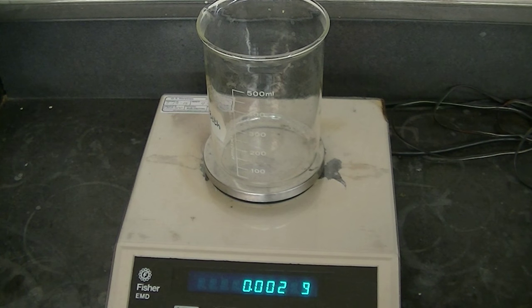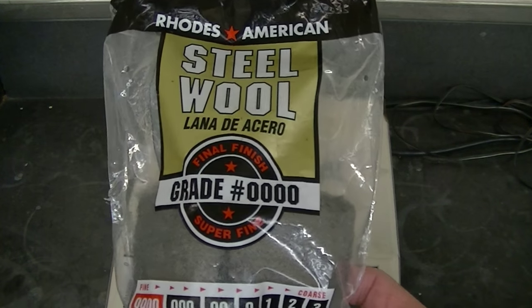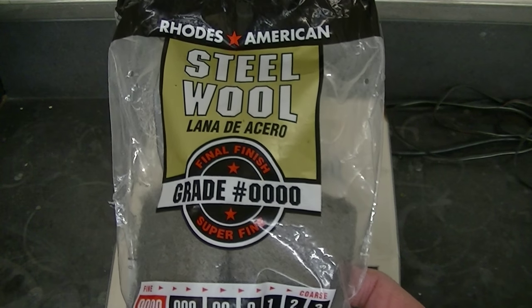Here's a quick and easy stoichiometry lesson. First, we're going to find the mass of some very fine, super fine actually, steel wool, which I'm going to assume is made of pure iron.